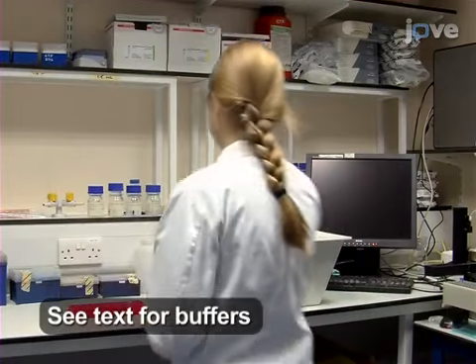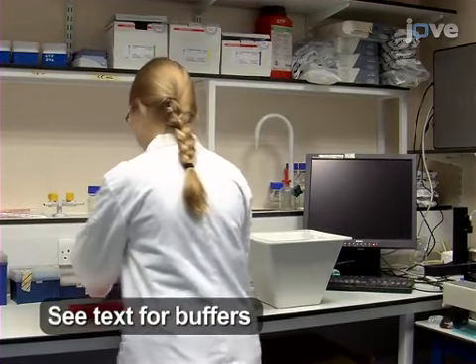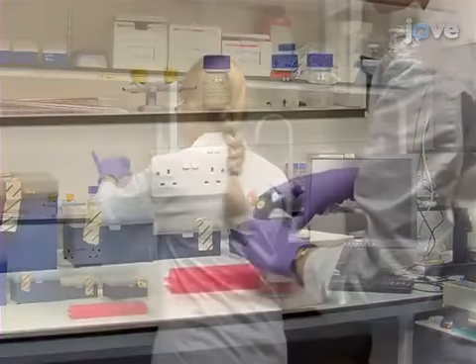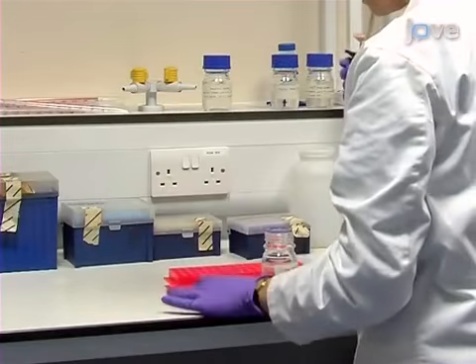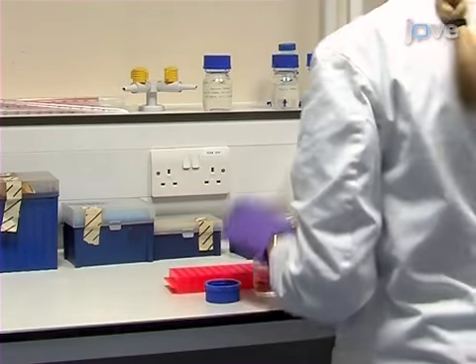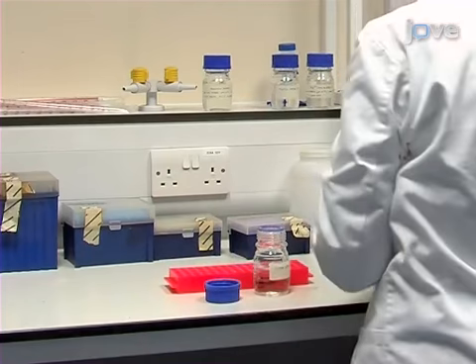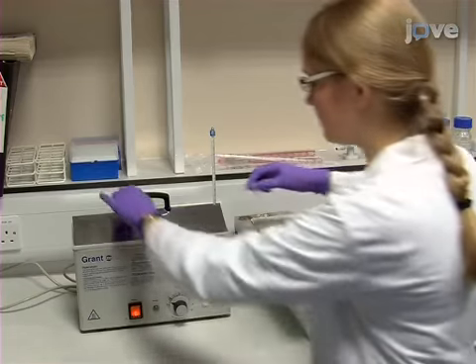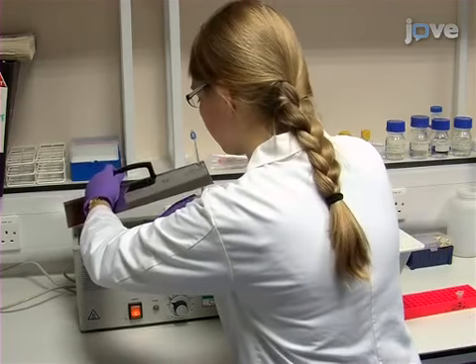After determining the fluorescence intensity of kinesin upon binding of MANT-labeled nucleotide as outlined in the text protocol, to a solution of up to 20 micromolar kinesin in magnesium-free buffer, add 1 millimolar of EDTA and 1 millimolar of DTT. Incubate the solution for 15 minutes at 25 degrees Celsius.